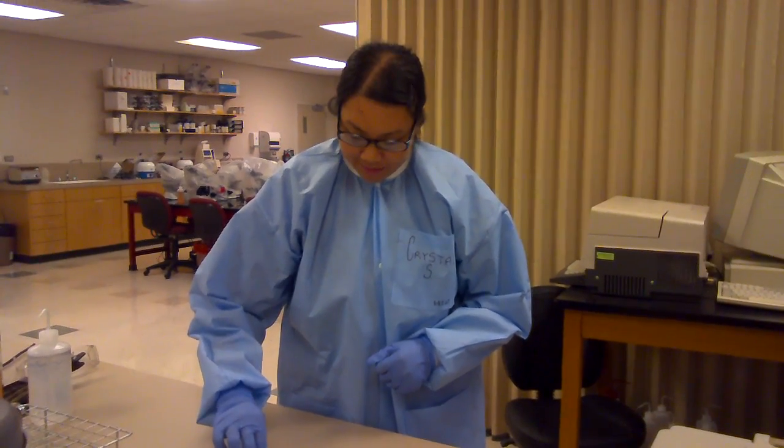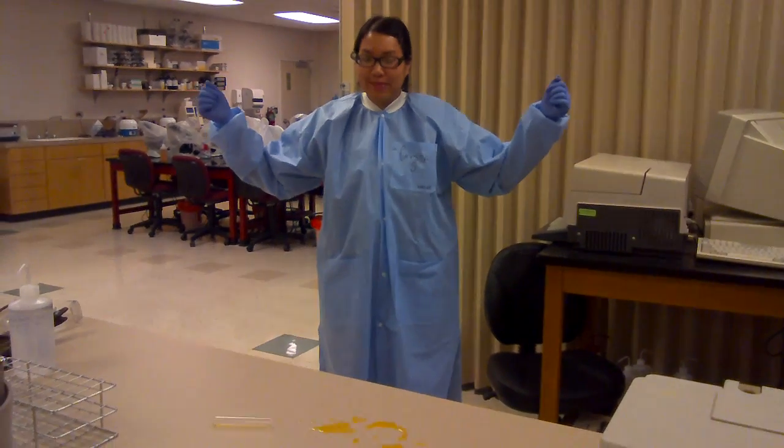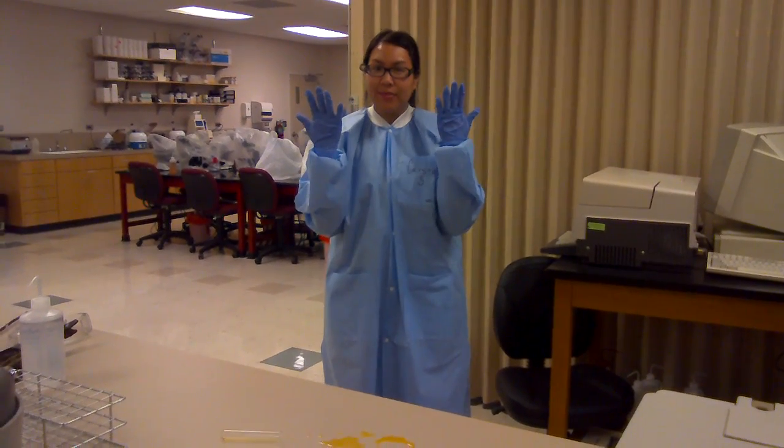Put on the appropriate personal protective equipment: lab coat, gloves, and goggles.